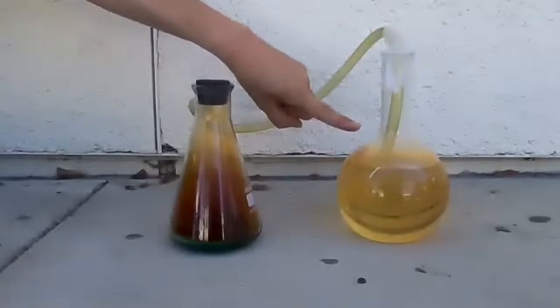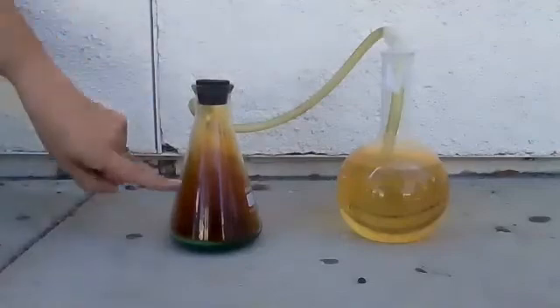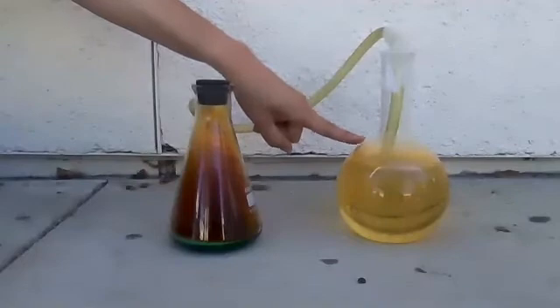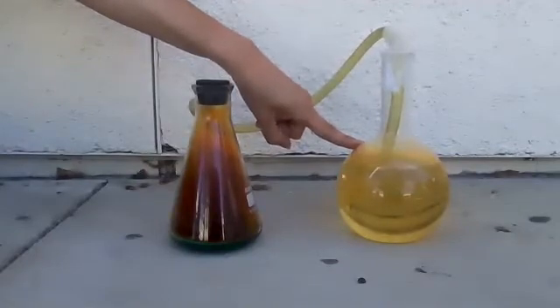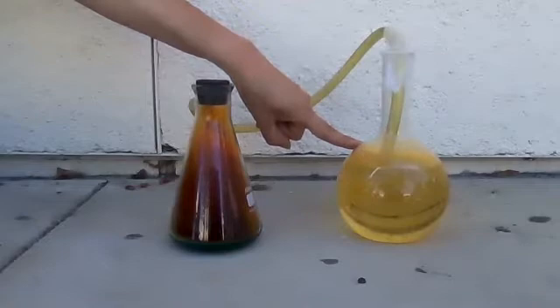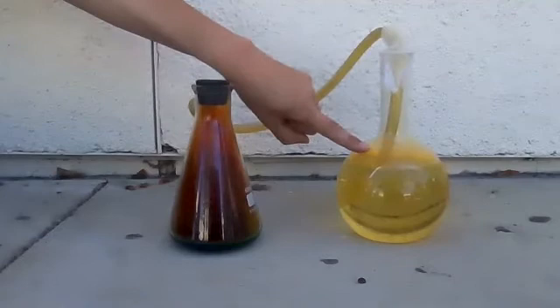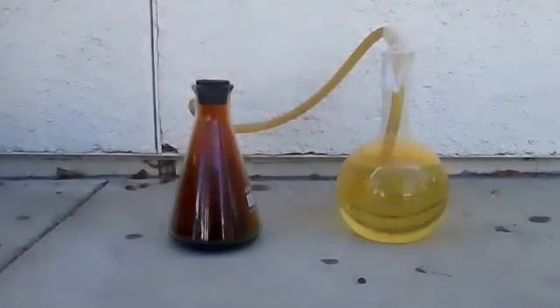It's turning yellow — it's turning acidic — because the NO2 gas, the only way it can go is in here. What happens when you mix NO2 plus H2O? You get nitric acid again.